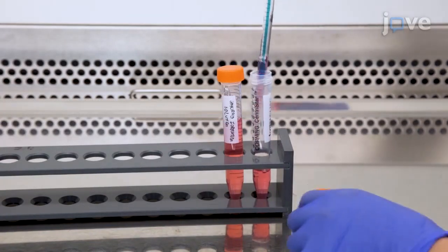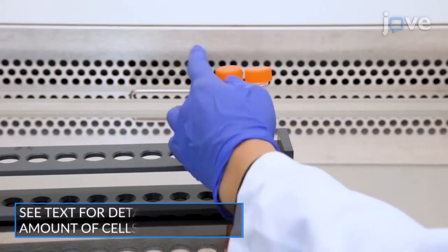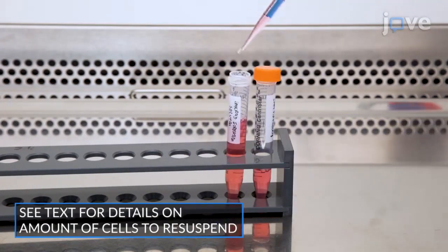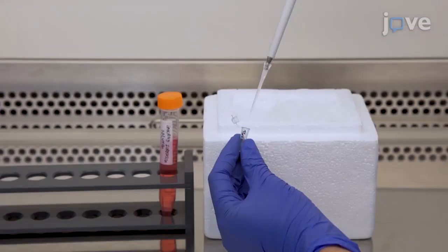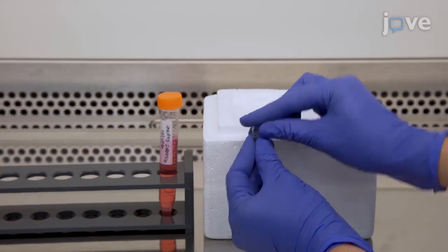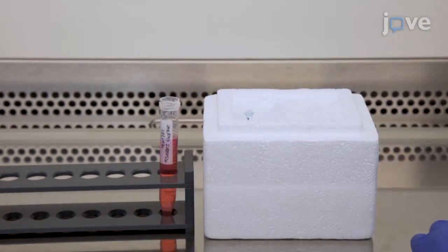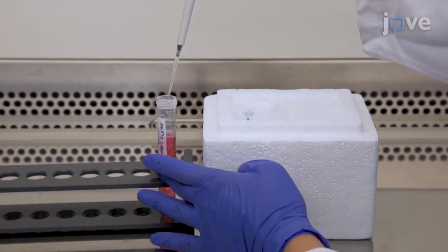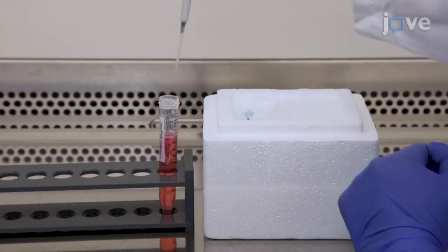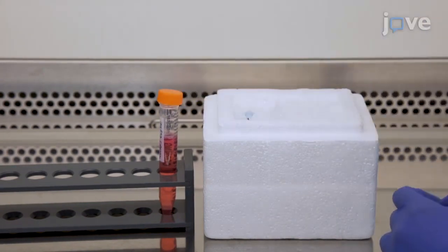Resuspend freshly thawed immortalized normal fibroblasts or other cell types as listed in the text protocol in the spheroid formation solution. If cytokines or integrin inhibitors are included in the study, add these compounds to the cell suspension in order to embed them into the spheroids during their formation. Where appropriate, add inhibitor compounds together with 10 nanograms per milliliter of TGF-beta1 to trigger differentiation in immortalized normal fibroblasts.